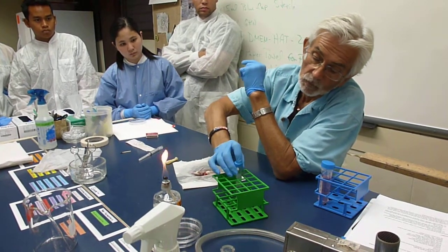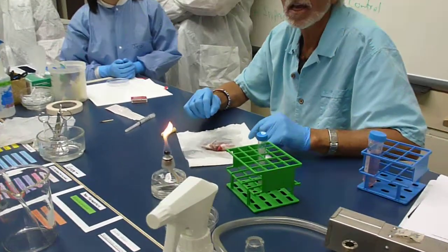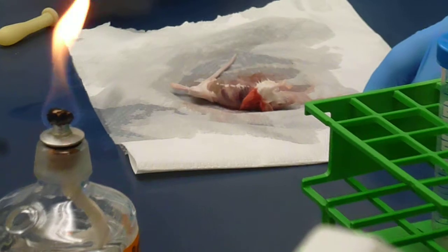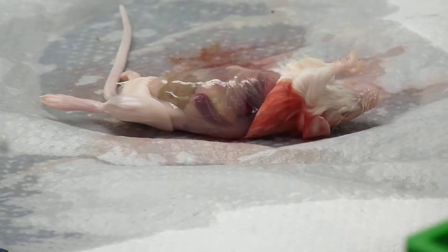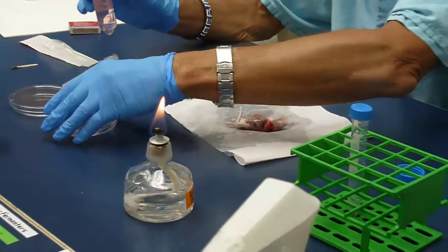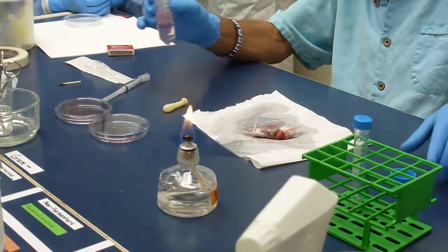After you're done with that, I want you to do a dissection of the mouse — that's the other thing I wanted to demonstrate. That dissection would be to find the spleen in anticipation of what we're going to be doing next time. The basic operation next time would involve taking two petri dishes and pouring a small amount of GKN into both.